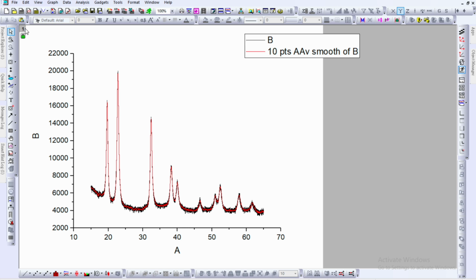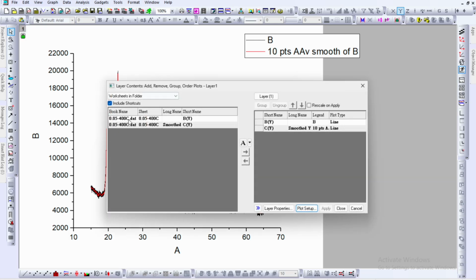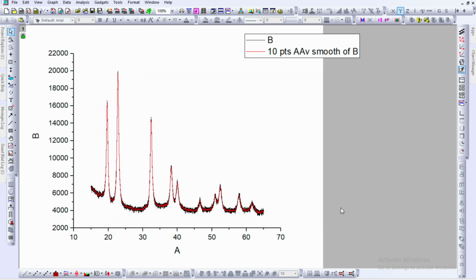Go to the layer 1 option that's on the left upper corner, double click. And here we can see column B is the experimental data and C is the smooth data. Select them, group it and apply.